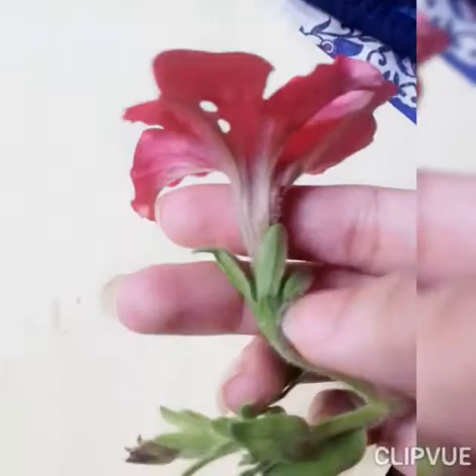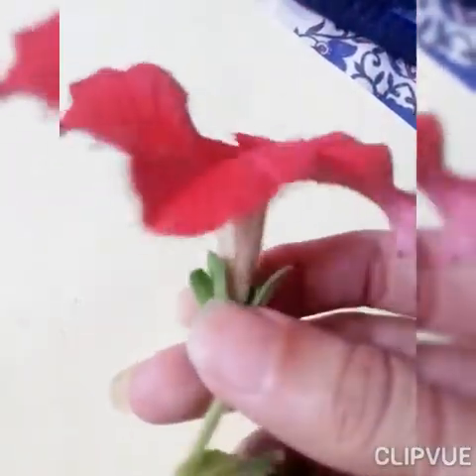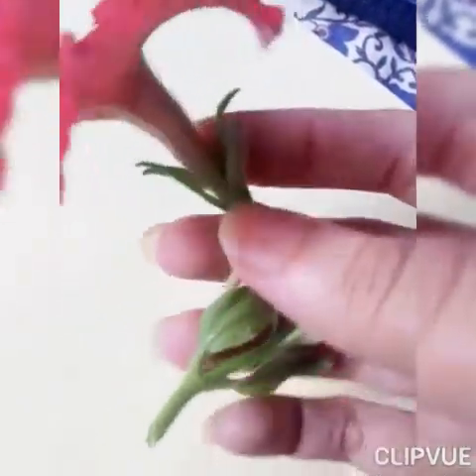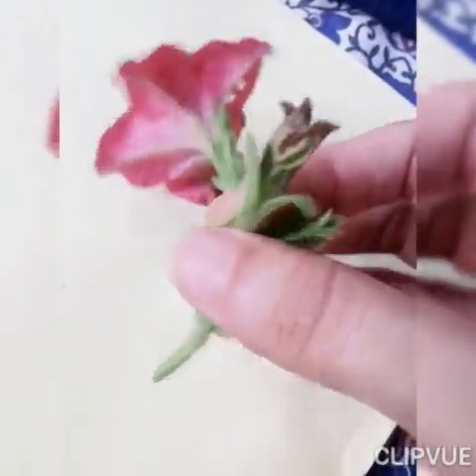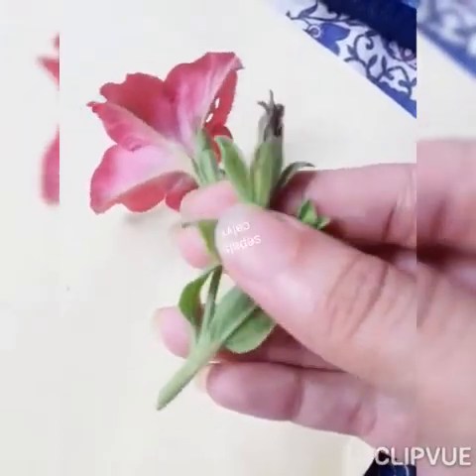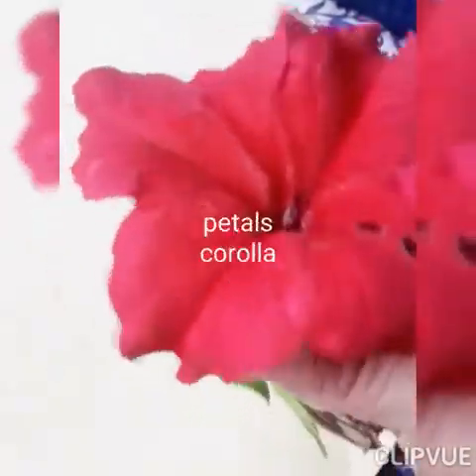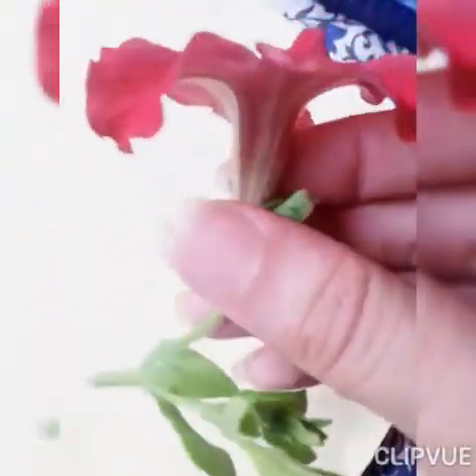Petunia has a trumpet-shaped flower, so you can easily identify petunia by seeing its trumpet shape. These are sepals — sepals enclose the flower in bud condition. You can see here clearly: sepals collectively are called the calyx. These are petals; petals collectively are called the corolla. Petals are usually brightly colored and have a beautiful scent to attract insects for pollination.